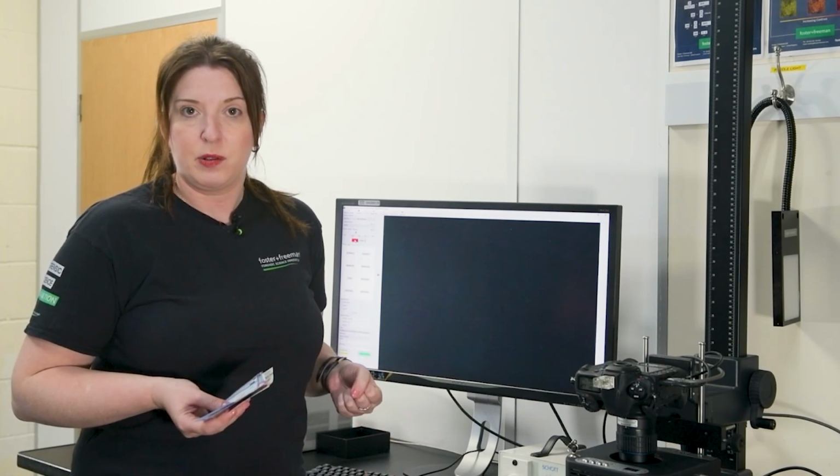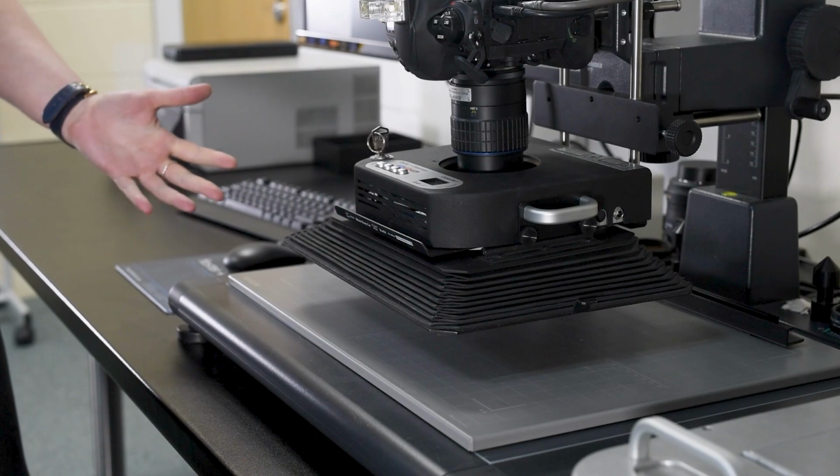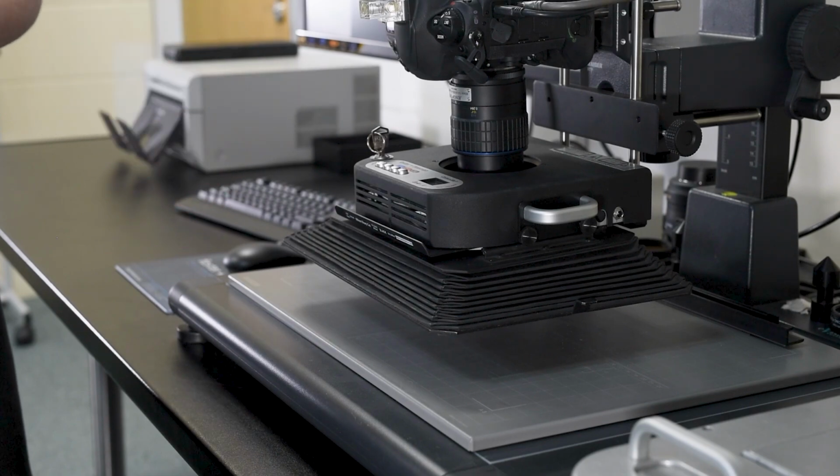Okay, so let's look at some of the most challenging samples that you can come across. Me and Calypso often do a lot of training all across the world, and one of the samples which consistently comes up is banknotes and currency. And how do we photograph finger marks with lots of different treatment types on banknotes? Now with DCS, we can employ a number of different methods to photograph fingerprints on banknotes. This could be either using lighting techniques, either with the camera, or we could even do this sometimes with the software to remove difficult backgrounds.